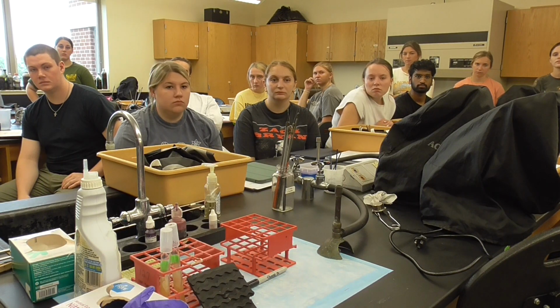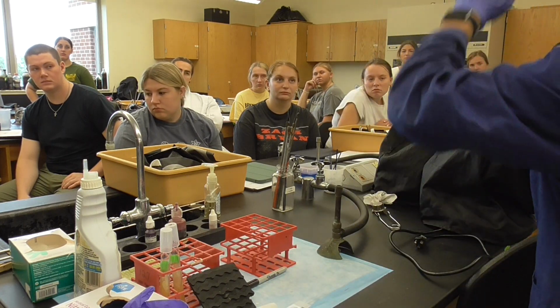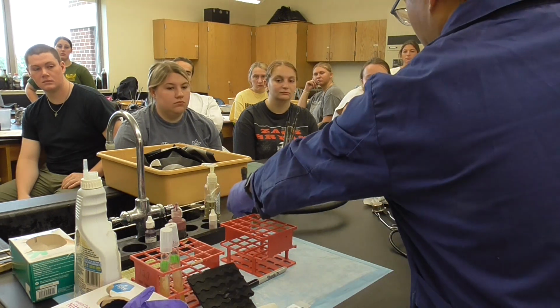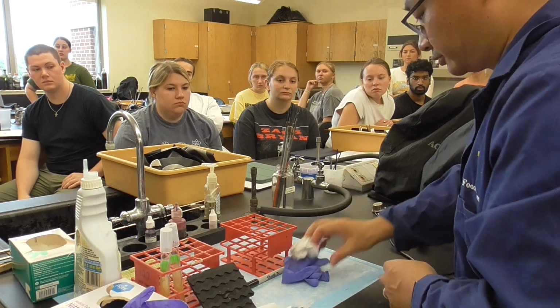Now, make sure this one is biohazard trash. So you're going to go to the biohazard trash can. And this, you don't need it anymore. Gloves actually you don't need anymore because it's already finished. You can take them out, okay, if you feel uncomfortable.